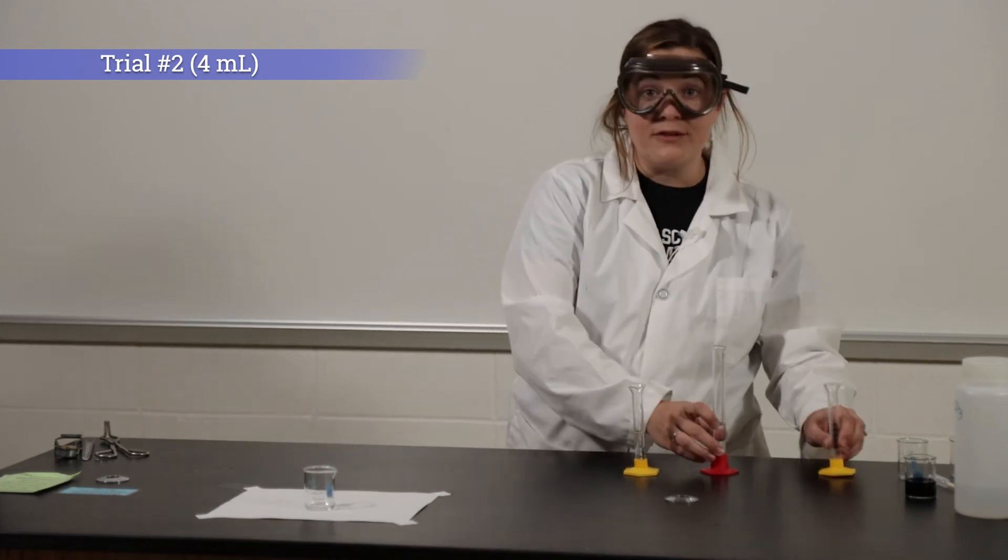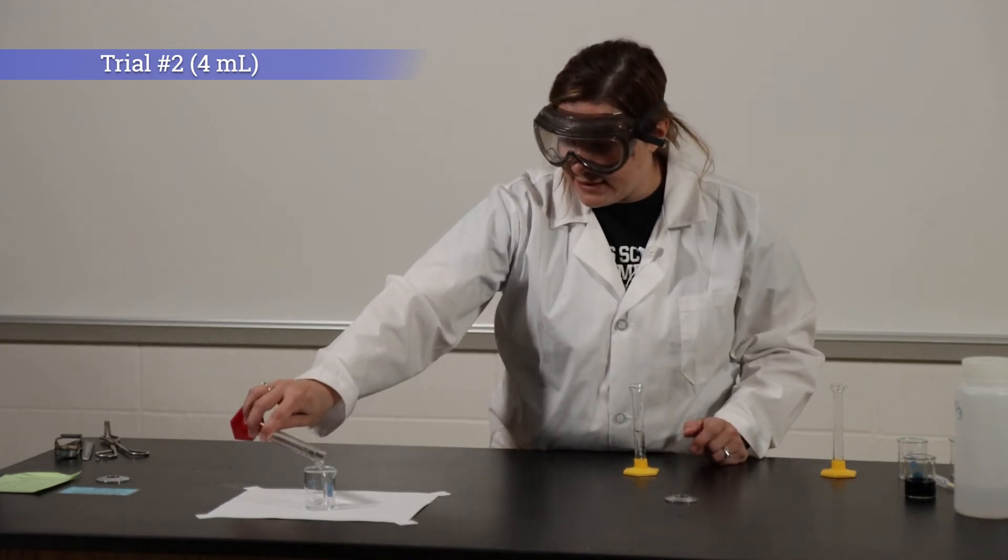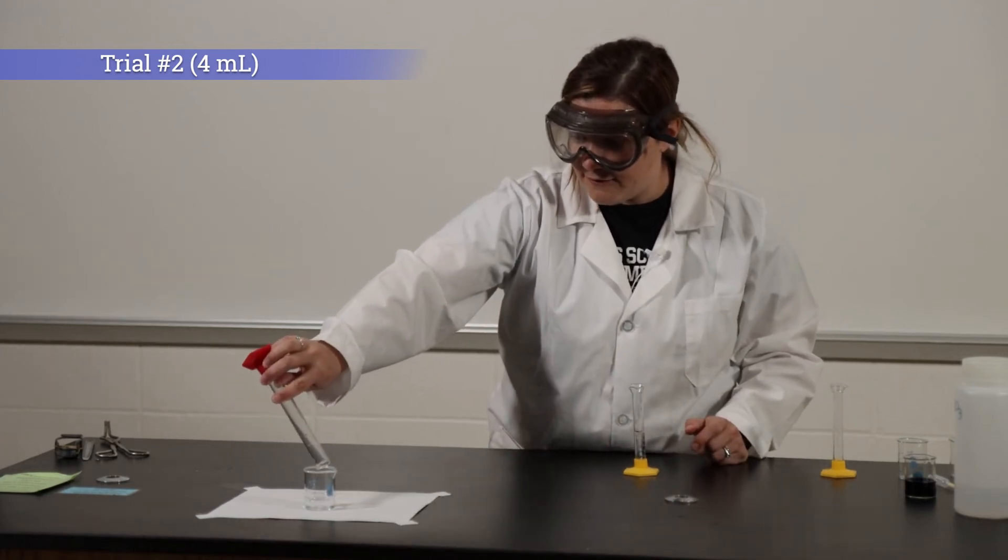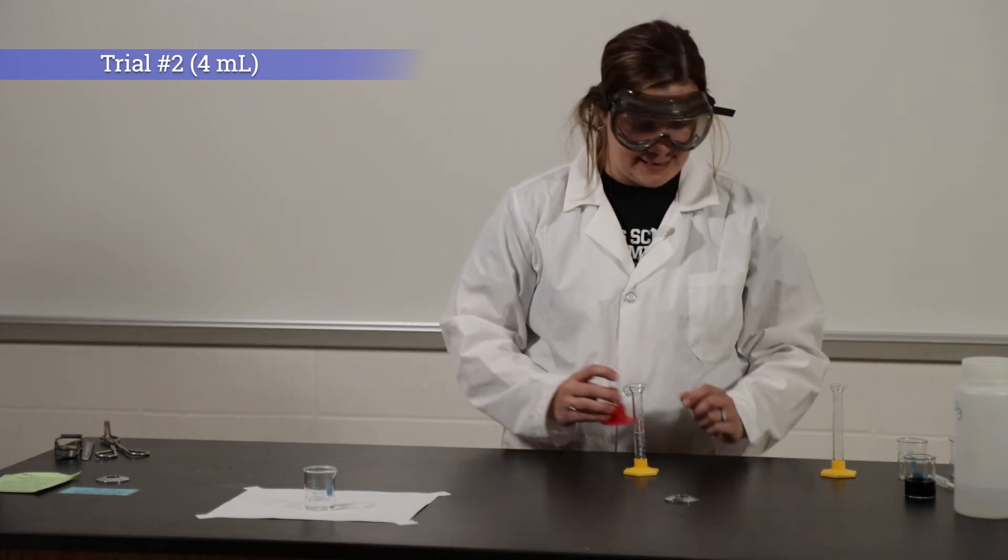and dilute it with 12 milliliters of water. We're always keeping our volume constant at 16 milliliters.